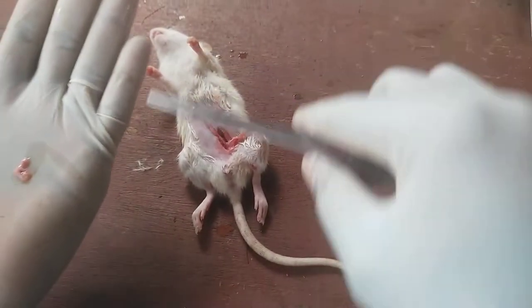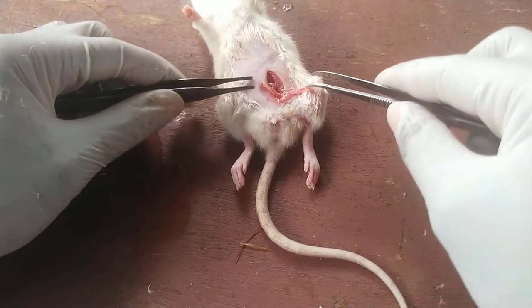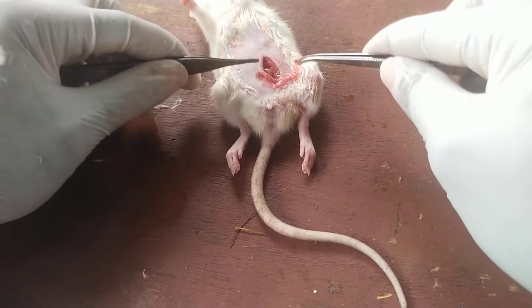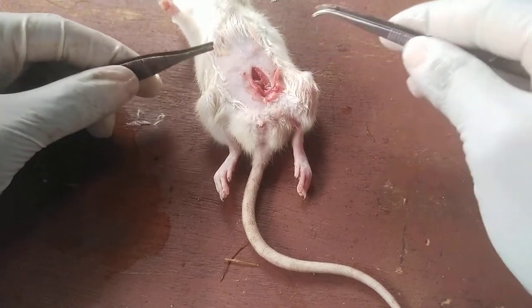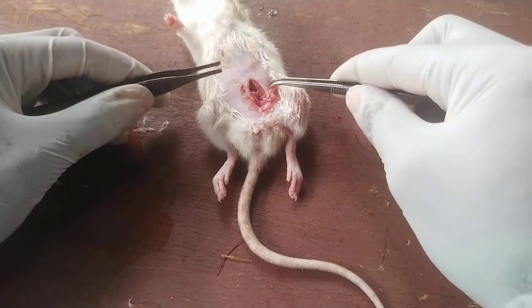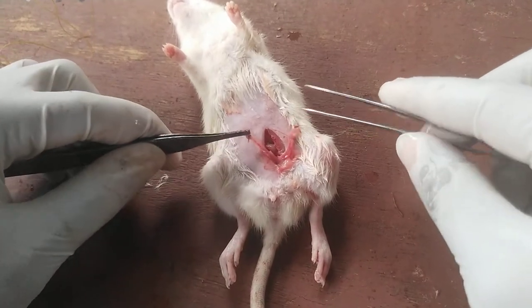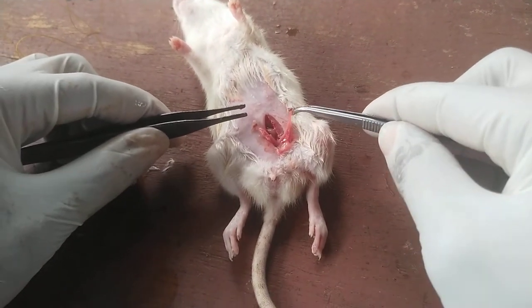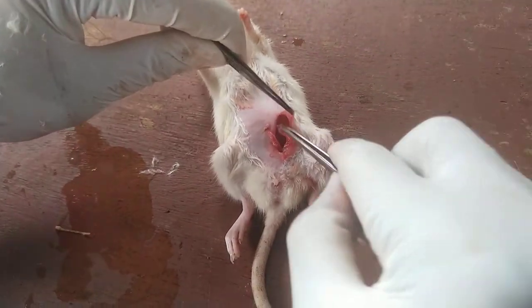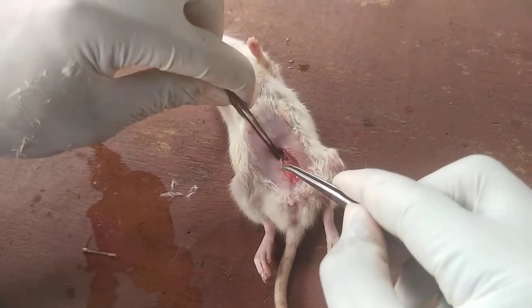We do the same with the other side. Having tied off both sides and removed the ovaries — this is the left side and this is the right side — we now need to put back the structures at exactly where they were collected from.